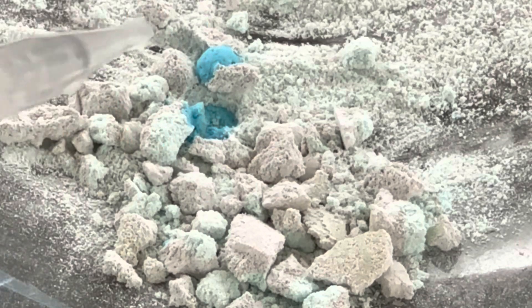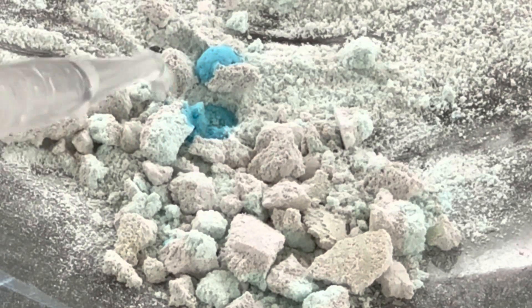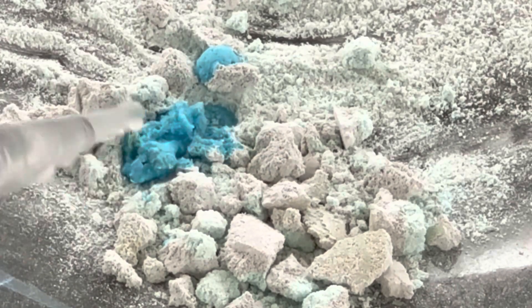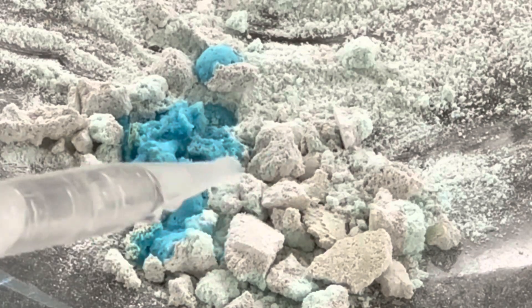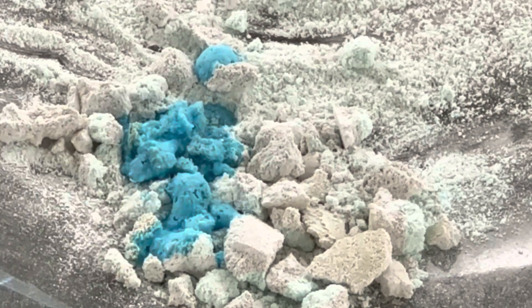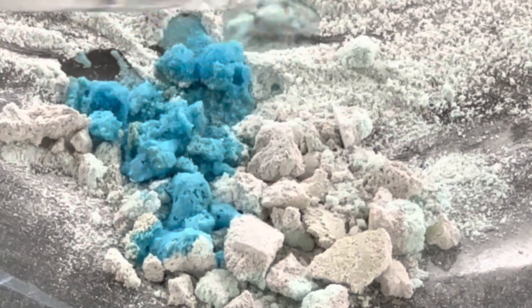Look at that! That beautiful blue copper sulfate pentahydrate returns. Let's add a few more drops — look what happens. That beautiful reversible reaction.